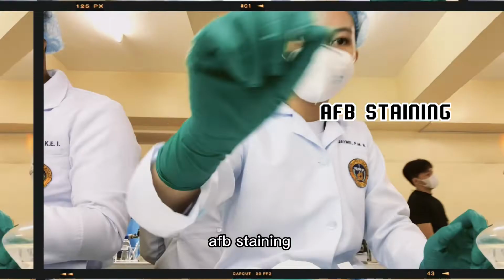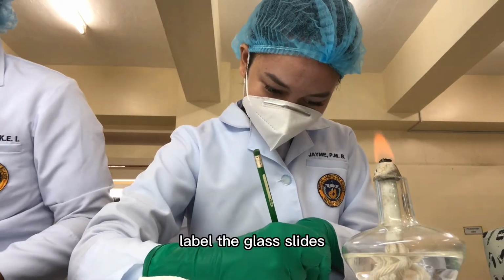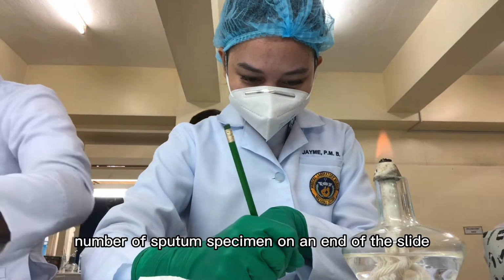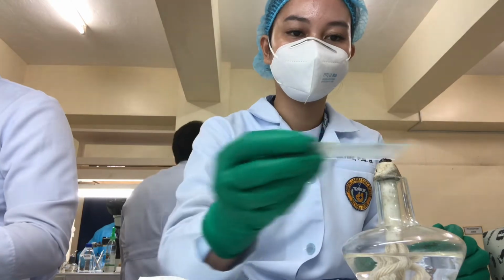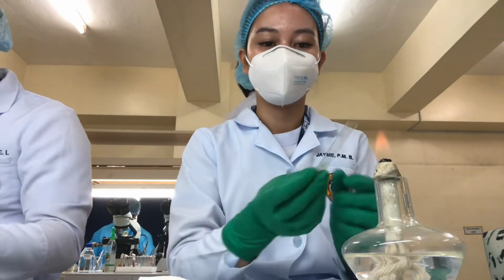AFB staining. First and foremost, label the glass slides. Write down the yearly serial number or order number of the sputum specimen on an end of the slide. Ensure complete confidentiality of the test. Pass the glass slides through the flames to avoid cross-contamination.